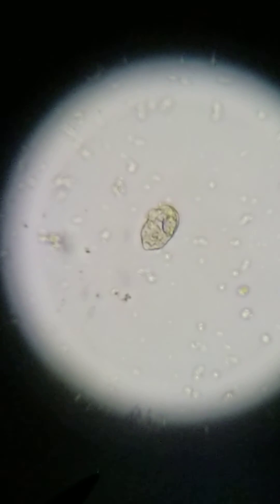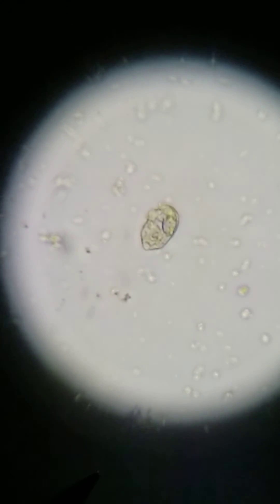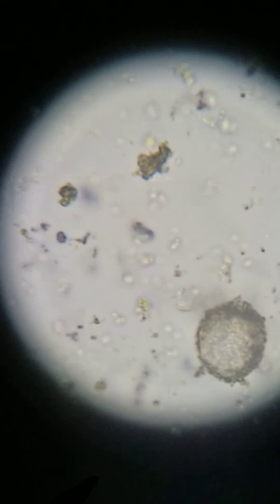We're going to go with that one as a transitional cell. It's a lot bigger than the renal tubular epithelial cell. We're just going to scoot around it to see if there's anything else cool.